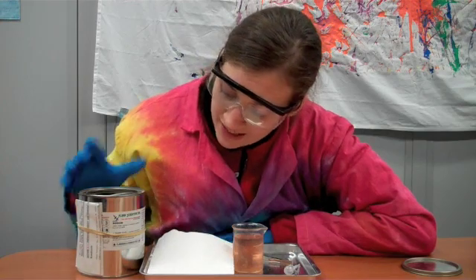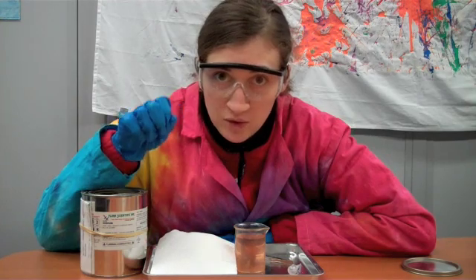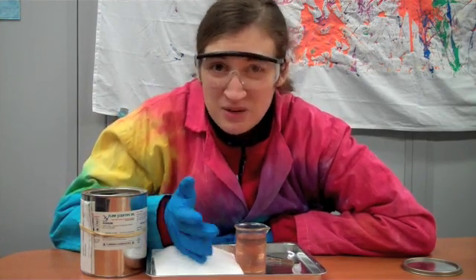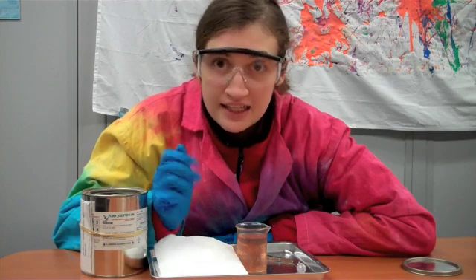What we're going to add is a chunk of sodium. So not a combination of things, but just regular old sodium metal, which reacts with water. Usually you can put things in water and nothing happens, but sodium actually reacts with water really quickly and it creates hydrogen gas and heat.